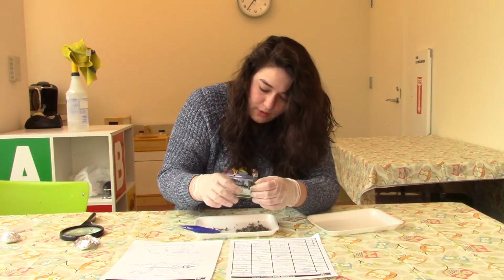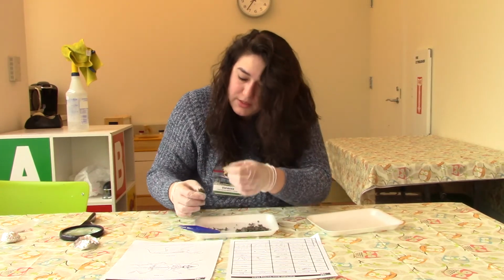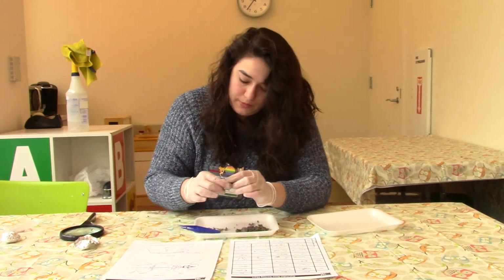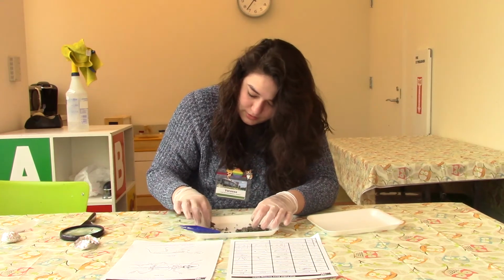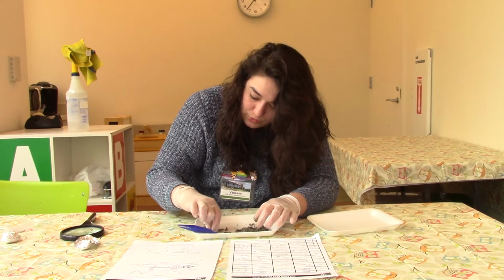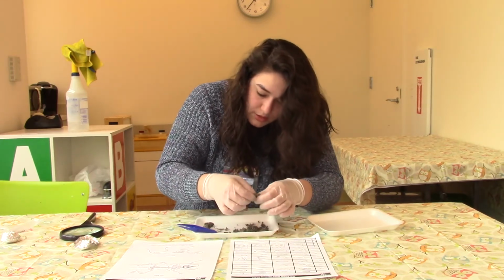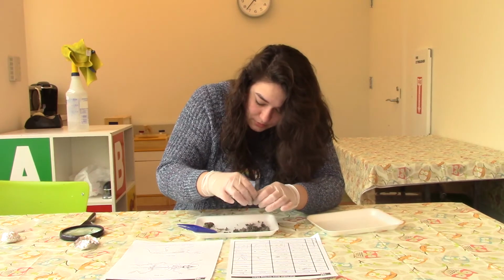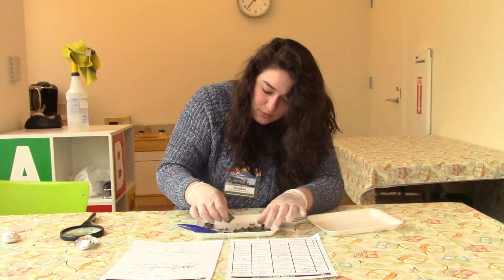We'll try to take off all of that fur. Yep, it looks like we have another jawbone right there. And here's another skull. So it looks like we have 1, 2, 3 skulls and 1, 2 jaws. Let me just double check and make sure that I didn't miss anything in here. There's a bunch of really small, fragile bones in here as well, and I want to try to take those out as well.